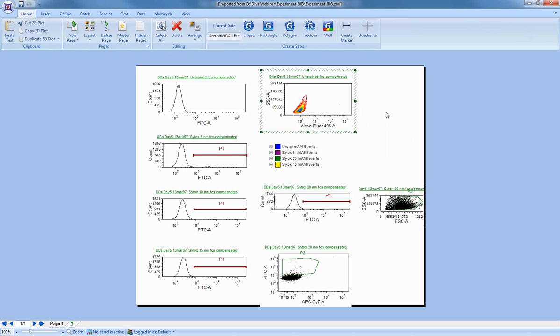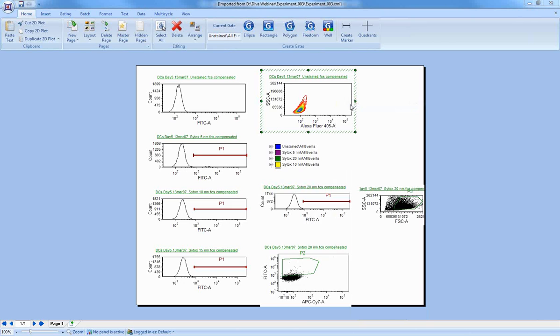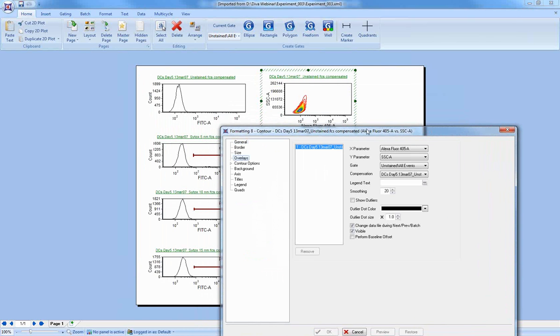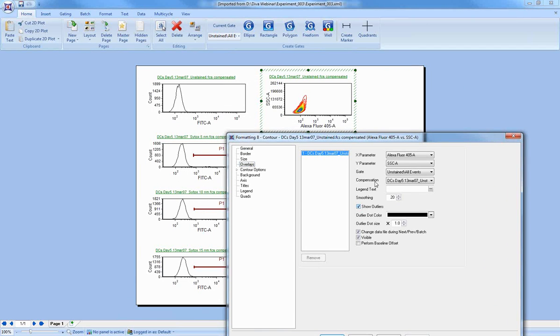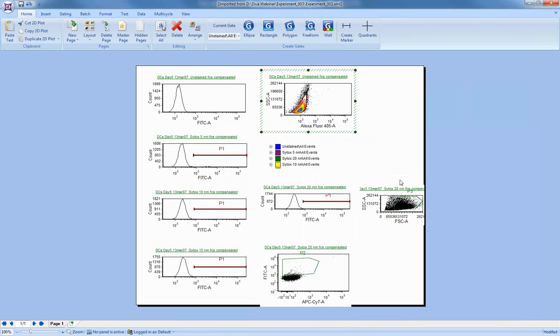Now, one difference I did want to point out: in Diva, the contour plot had outliers. In FCS Express, that kind of thing is very easy to add. If I just right-click on the plot, go to Format, under the overlays, there's a choice to show the outliers. When I preview, you can now see the outliers in there, and let's press OK. So anything like that about the configuration of the plot is very easy to change in FCS Express.